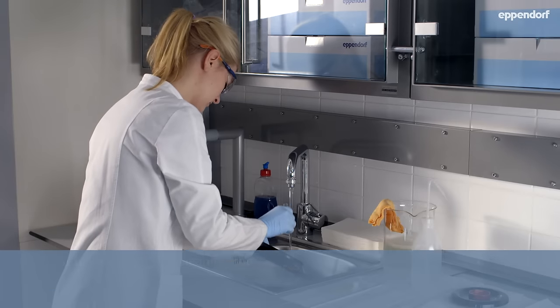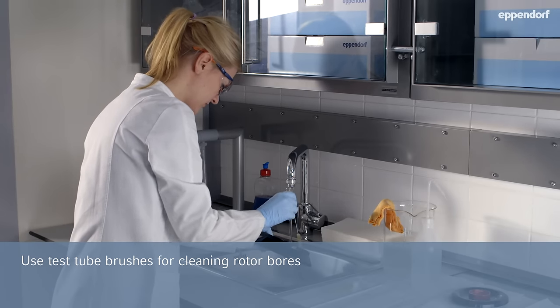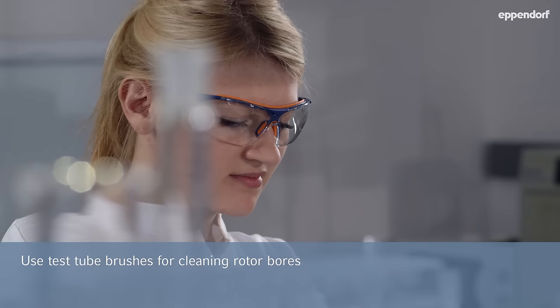For cleaning rotor bores, stiff test tube brushes with end bristles and non-metallic tips are best.